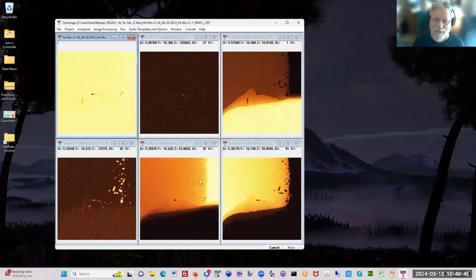And here are the quantified maps. You'll now notice that the Z value is now in weight percent. And this is the total map right here. You can see the totals are close to 100. The Z is close to 100.